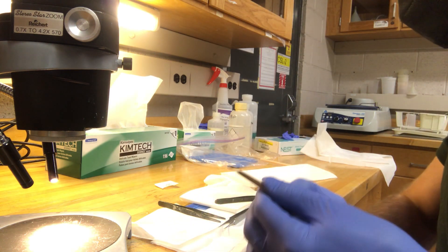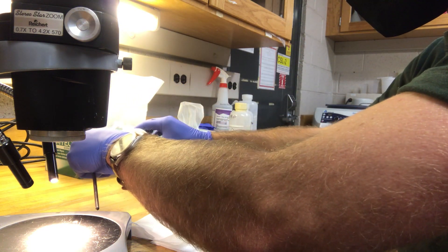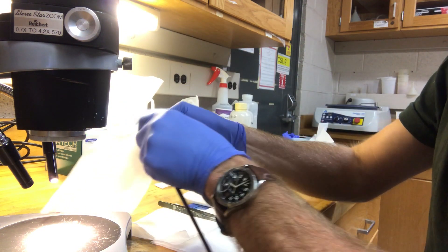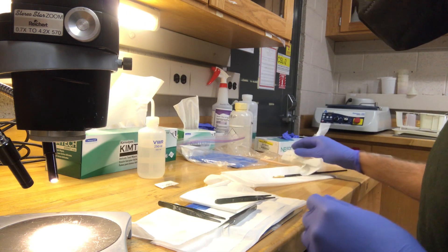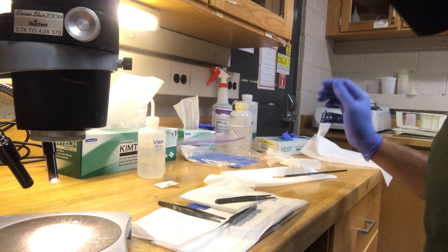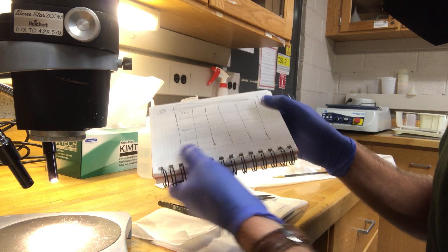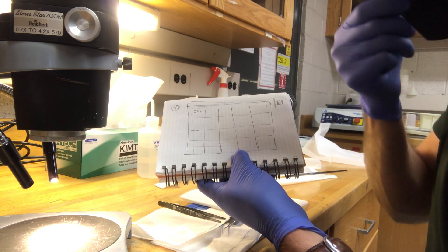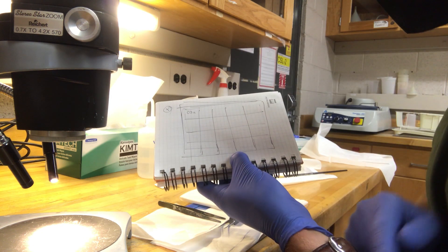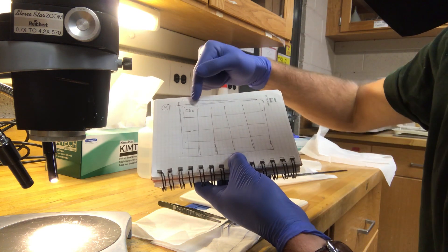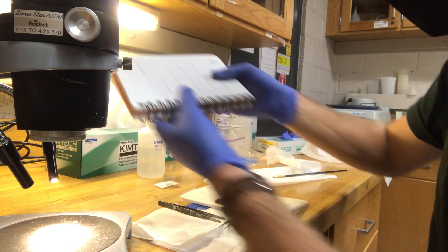When you're done with that, you can just clean it with a bit of ethanol and a kim wipe. Now something I've forgotten is we need to also have a map of this mount. So we've got our X in the top right corner to denominate where we are. The most important thing when we're doing our sample prep is label, label, label. So we've got 03A for our first sample and I'm just going to put 03A2 in the second column.